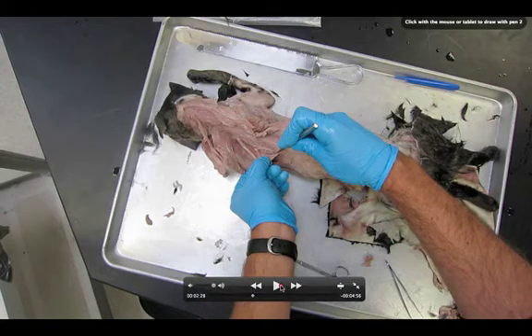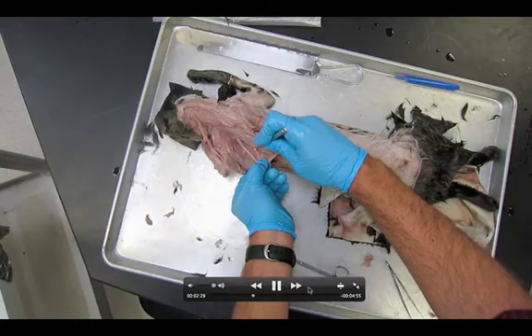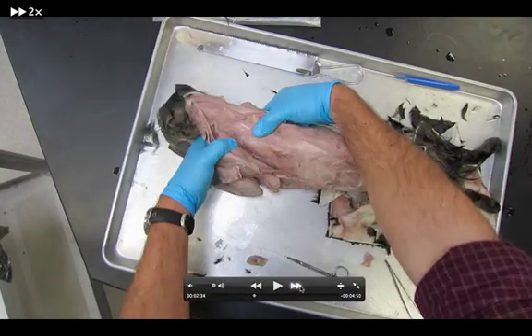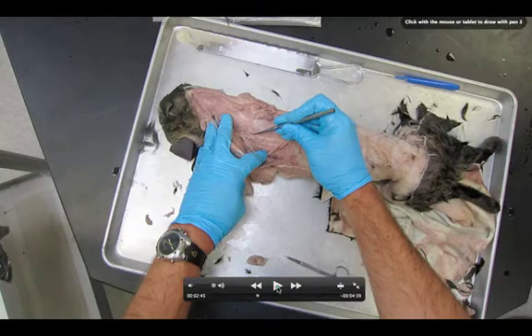Right here, let's pause so we can see the muscles. The muscle I'm peeling down is the serratus dorsalis; the one over here is the serratus ventralis. Underneath I can see the subscapularis. What I'm starting to expose right here looks a lot like bacon — it's called the iliocostalis. That's how you know you see it: it literally just looks like bacon. I'm peeling it down, and there's the bacon. I'll highlight it in green so you can see it clearly — that is the iliocostalis. The serratus dorsalis has been pulled down.